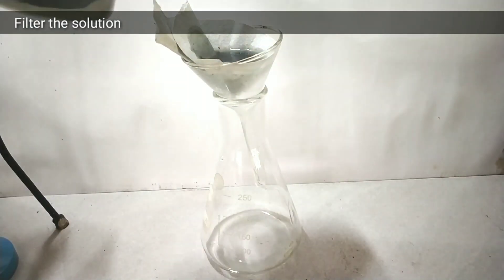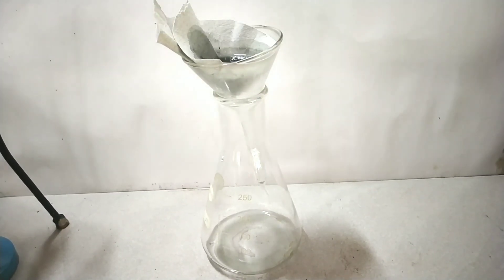Next we will be filtering the solution. For filtering I am using a simple gravity filtration. Filtering will remove all those unreacted particles and you get a clear solution as the filtrate.